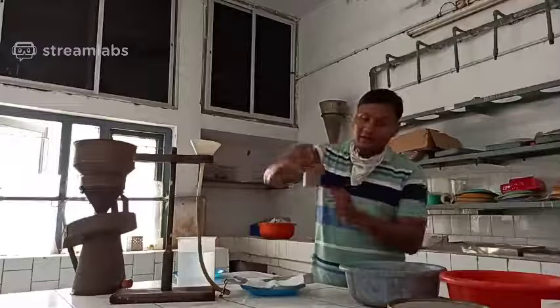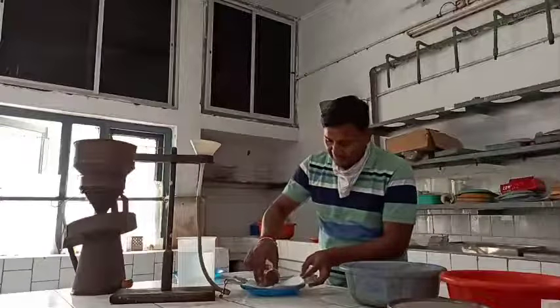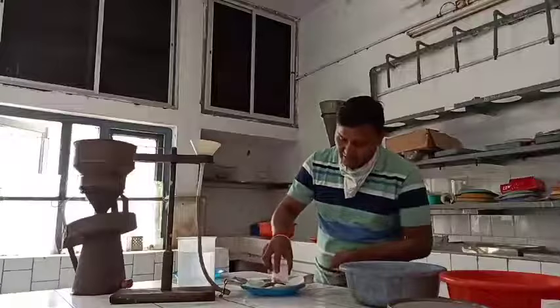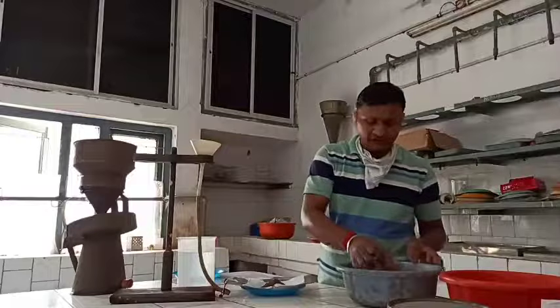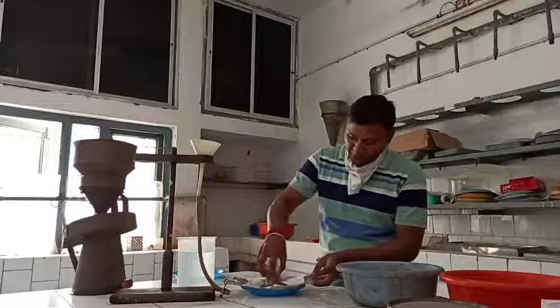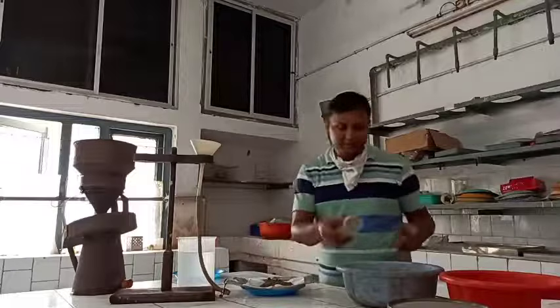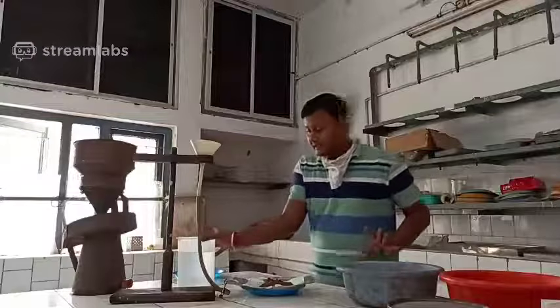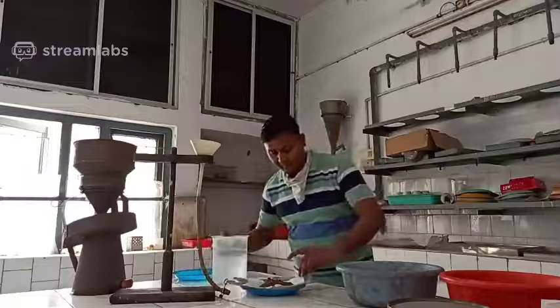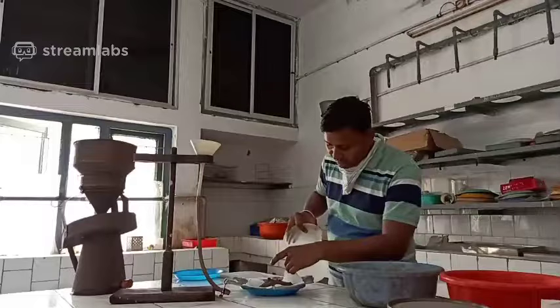Now I am taking a 100 ml beaker, so I am taking 200 cc soil, means two beakers. This soil is 200 cc, means cubic centimeters. Thereafter, from one side, this tray will be filled with water.